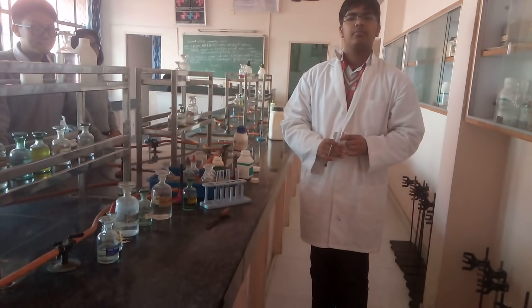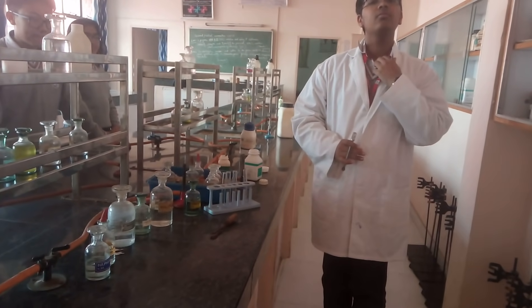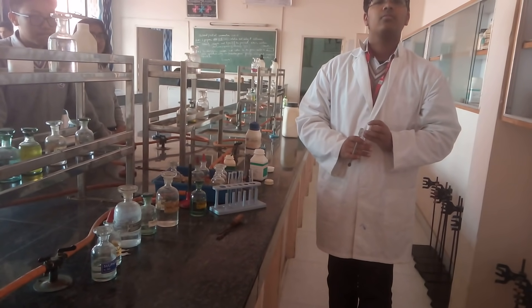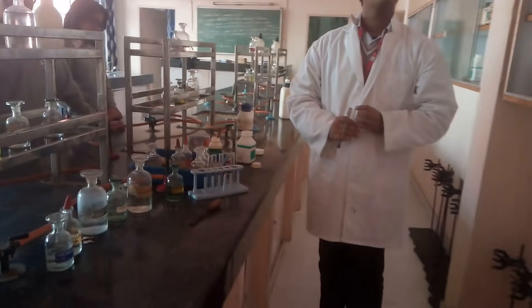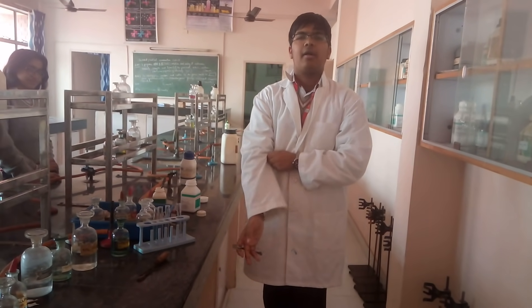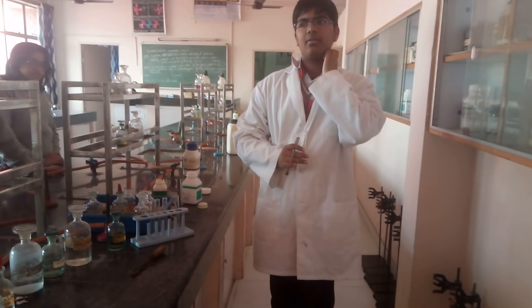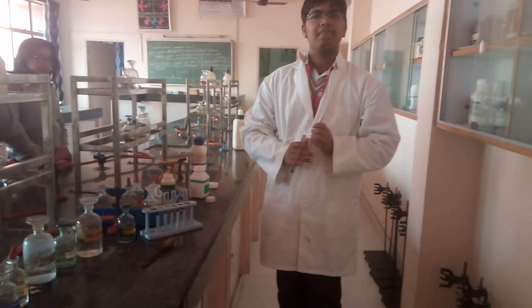Good morning students. In today's class we will be doing the anion analysis for sulphate. For the anion analysis of sulphate, my student Karan would be performing the experiment, and for sulphate you need to follow specific steps.